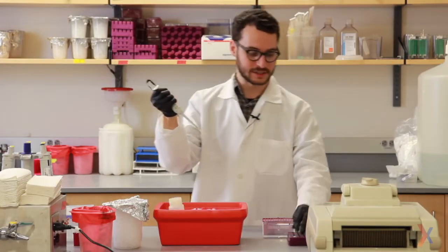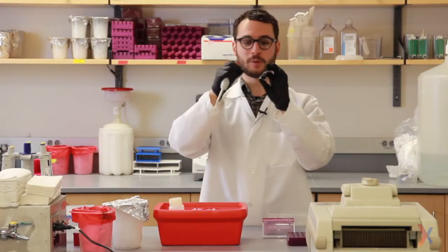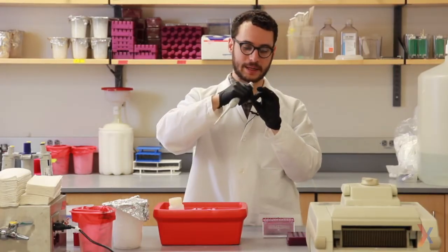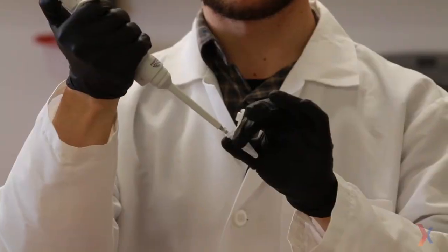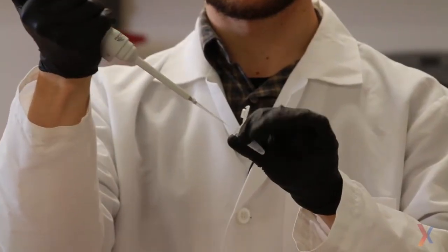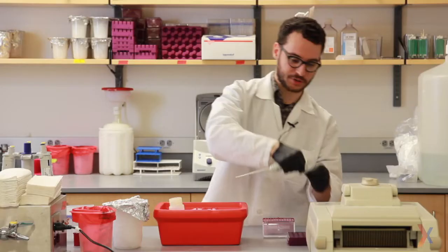I'll be adding these components to the PCR tube, which is very small and has thin plastic lining to enable it to change temperature quickly. The reactions also happen in small volumes so that they can change temperature very quickly.